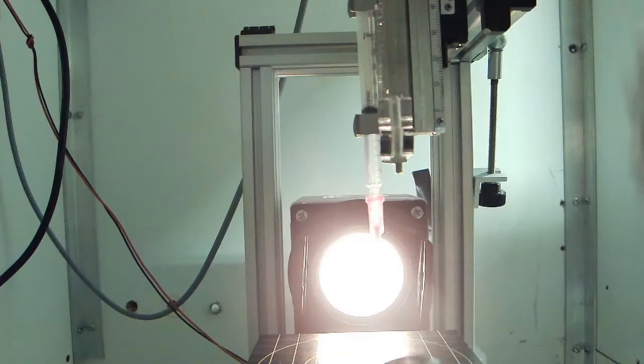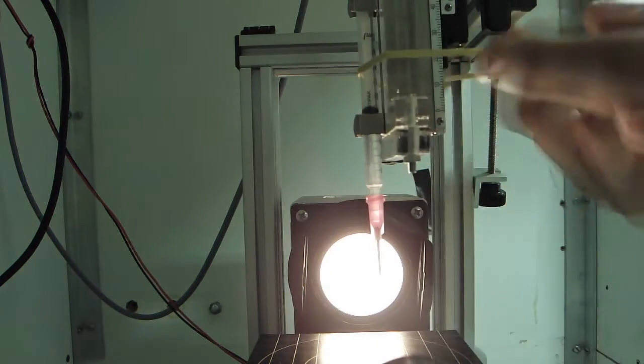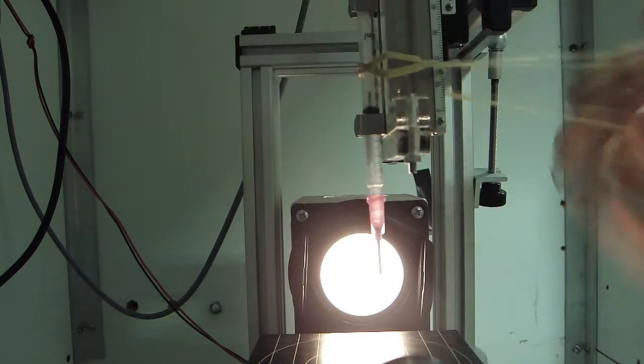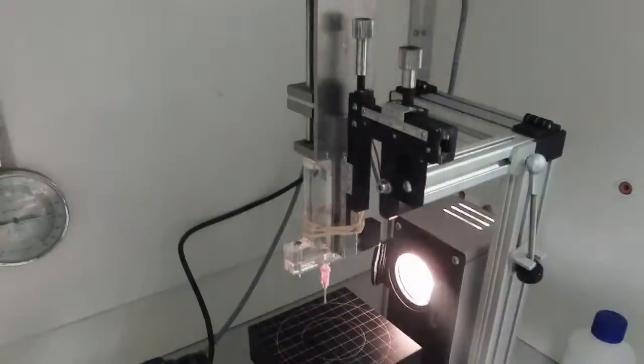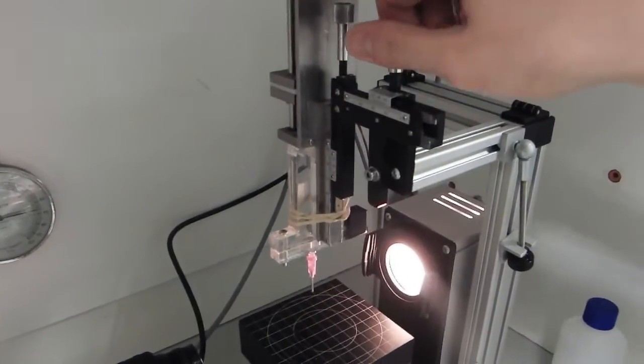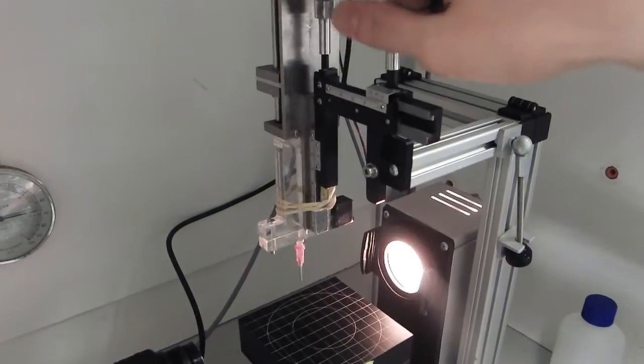Since this is a relatively small syringe, we secure it using an elastic band. The horizontal and vertical position of the syringe can be adjusted using these dials.